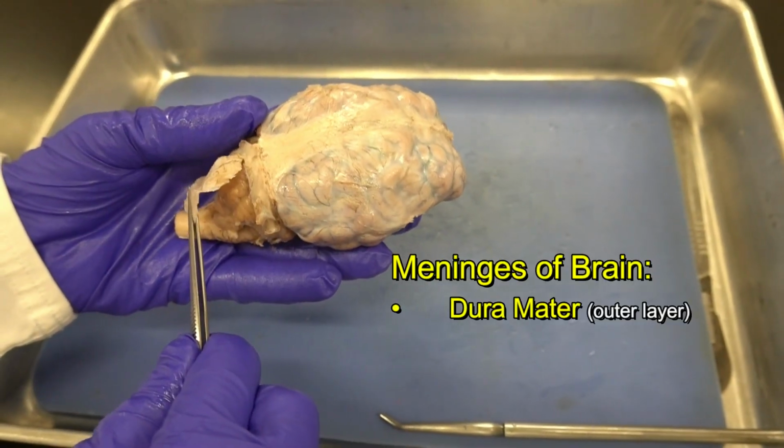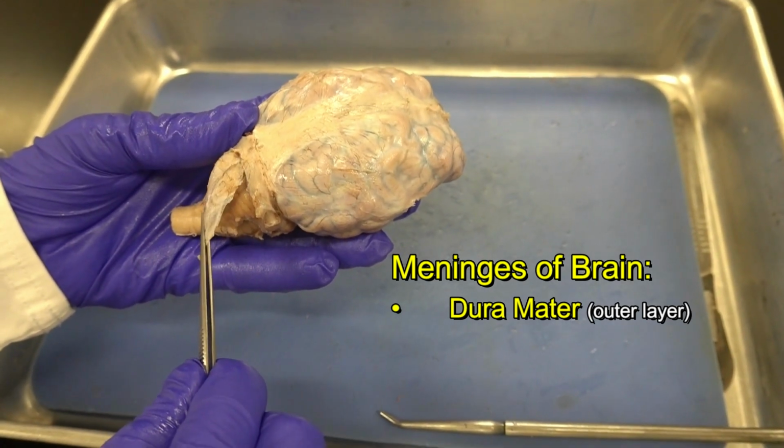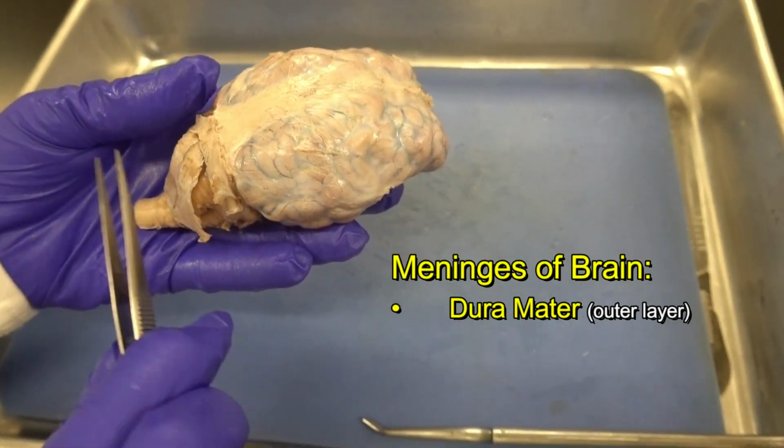Dura mater is made of dense, irregular connective tissue. It's extremely strong. It's full of collagen bundles. And obviously, one of the major things that it does is protecting the brain.